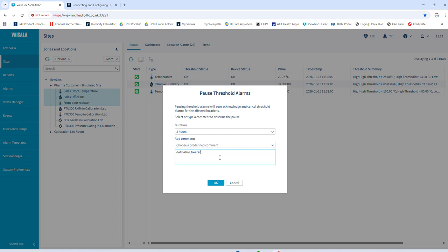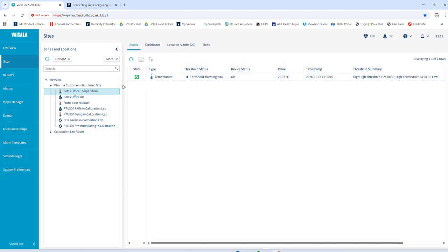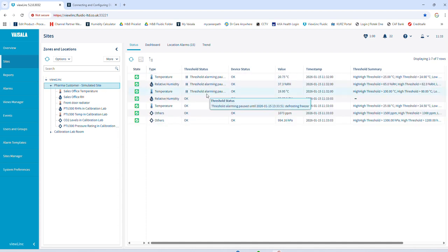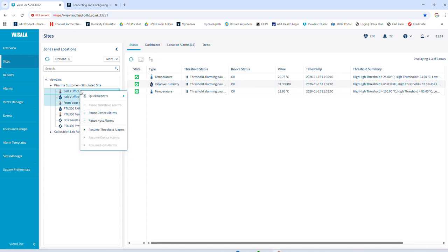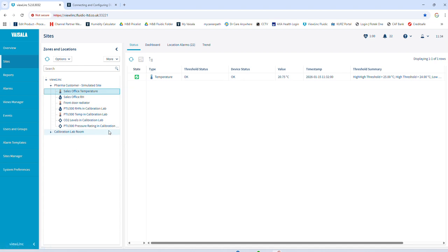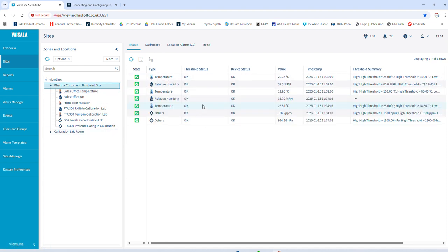I'm going to show you something about this as well, predefined. Defrosting freezer, okay, and threshold alarm paused. There it's paused them all. In fact, if I go back to the simulated site, there's the ones paused. And just to show you, I could resume threshold alarms and everything's back to okay again. So that was it manually resetting, but like I say, if you'd forgotten, after 2 hours it would have done it.